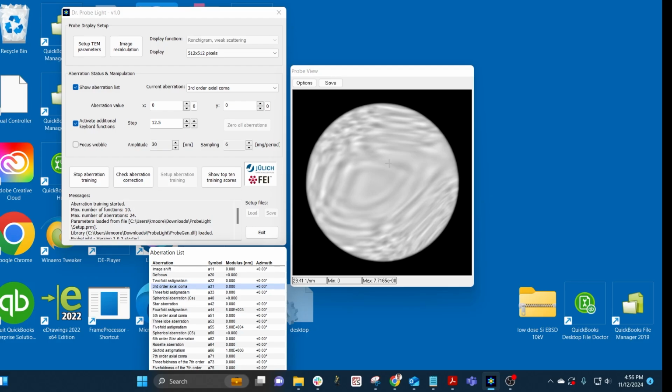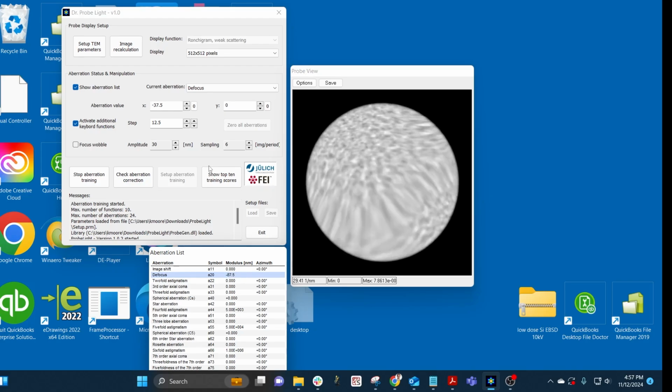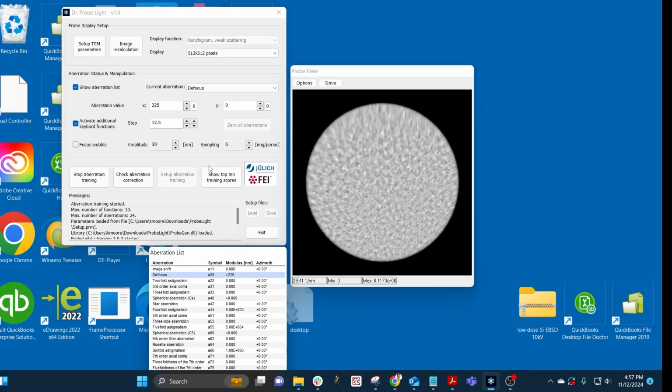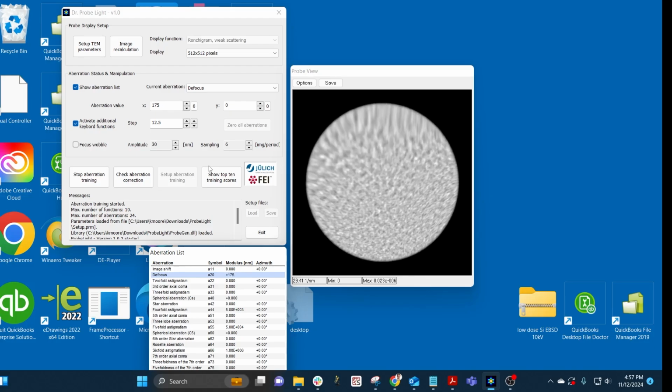So I can see in the middle, this kind of diamond shape is obviously coma. Going straight to coma, I can move in and out of focus to see what it actually looks like. So moving in and out of focus, that's definitely coma. You can see it going from top left to bottom right of the screen.